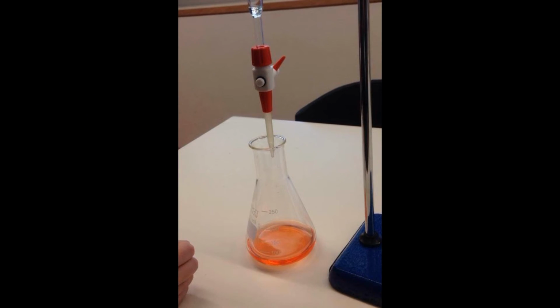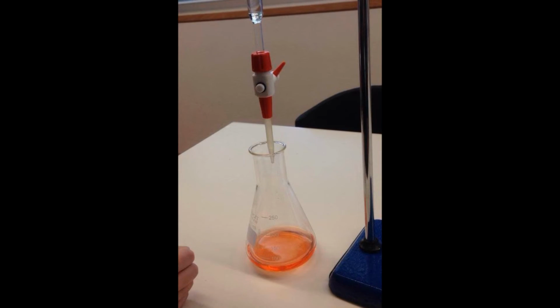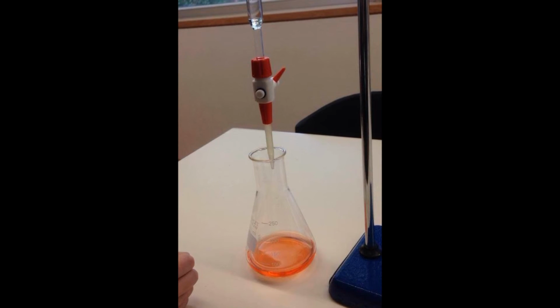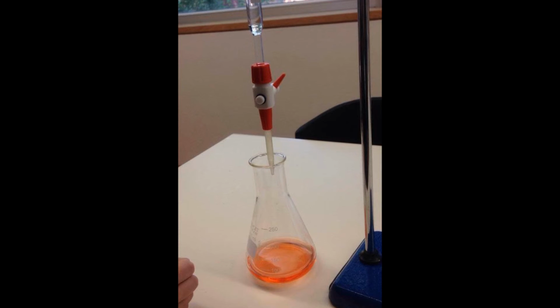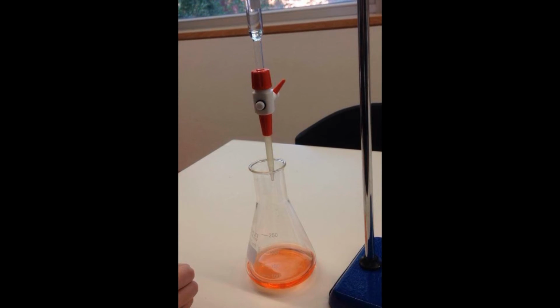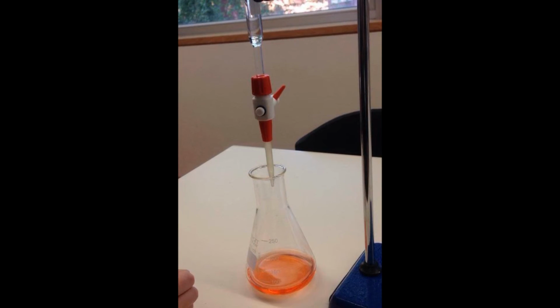Step 6. The titration may now commence. Begin titration by slowly letting the burette's content pour into the flask. The titrant may flow relatively fast at first, then slowly nearer to the equivalence point. The burette should be stopped on the first sign of a color change.